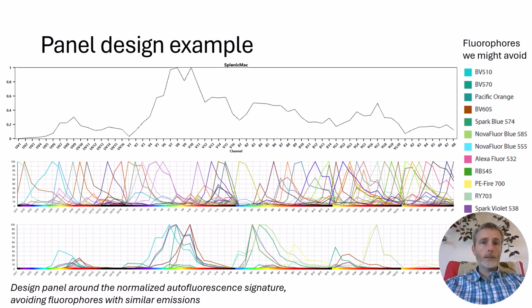With panel design, a simple approach is to avoid fluorophores with spectral similarity to your normalized autofluorescence signature or signatures. In the case of mouse splenic macrophages here, we might leave out fluorophores in the middle of the violet, the short end of the blue, and mid-far yellow-green, such as those listed here by name. Leaving these out will reduce misassignment of the autofluorescence signature as our panel fluorophores, and consequently as markers in the unmixed data. The middle band here shows fluorophores that would probably be acceptable to use, while the lower band and the list on the right shows fluorophores that we might want to avoid due to spectral similarity to the autofluorescence signature.